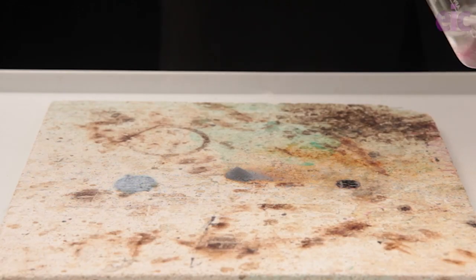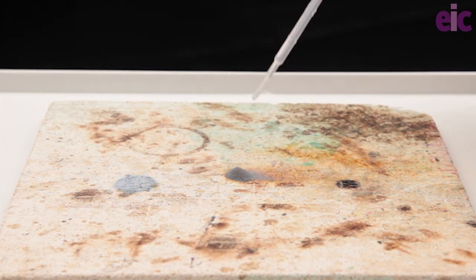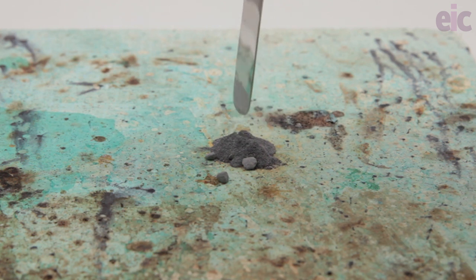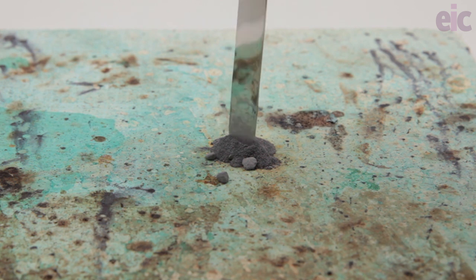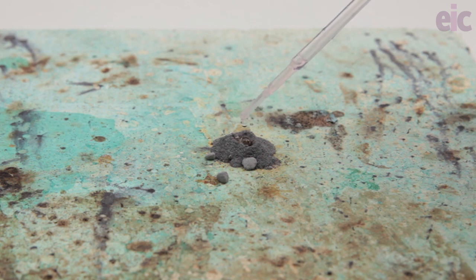The particles in the two solids don't have the opportunity to collide very effectively with one another, but if we introduce a little water and some washing up liquid to help with wetting, the reaction can get going after a small incubation period. With the small amounts that we're using here, it's quite handy to gather the powder together into a little pile, and I often gouge out a little hole in the top into which I'm going to place the water with washing up liquid.